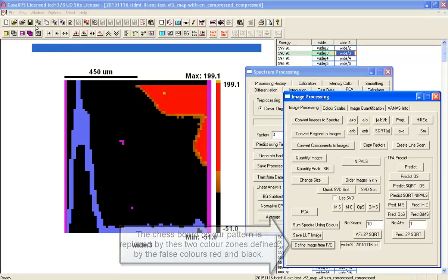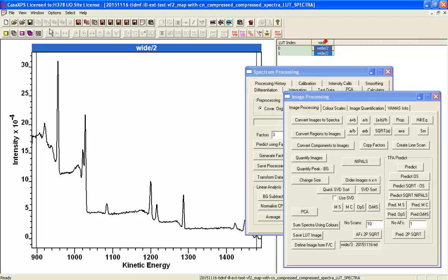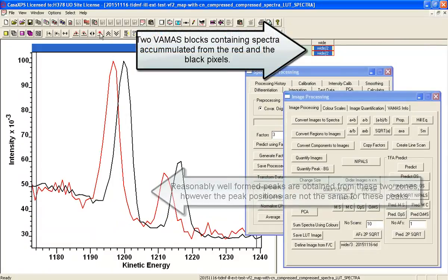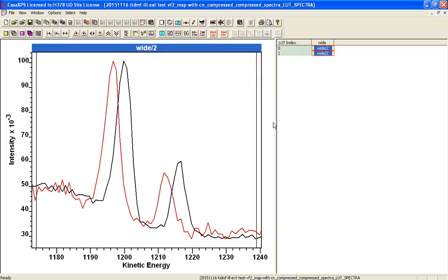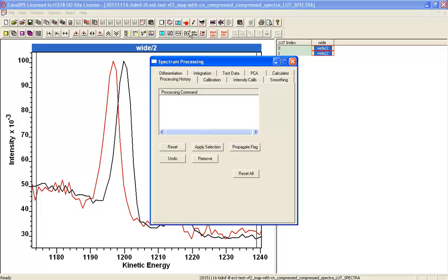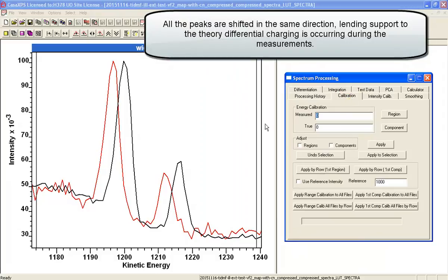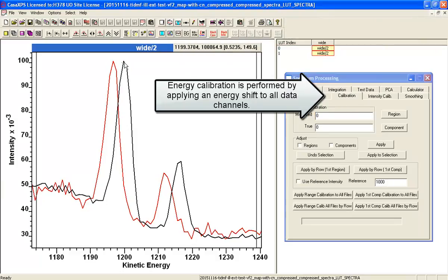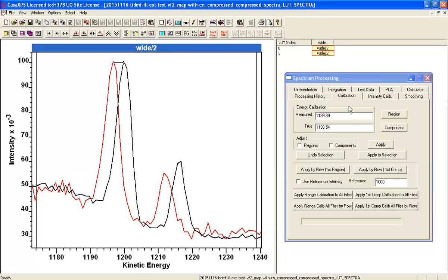And now if I go to the spectra pixels and I sum these, I get two spectra, and I can see that there's clearly a shift. So there's evidence that this sample is certainly charging. Now let's actually do a little bit more than simply see that there is a shift. Let's see how the shift is performing overall. So I've gone to the energy calibration. I'm going to hold the control key down so I can move this spectrum, the black spectrum, over the red one, and then press apply.